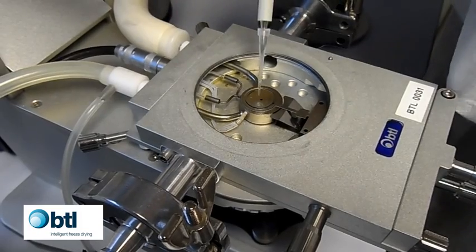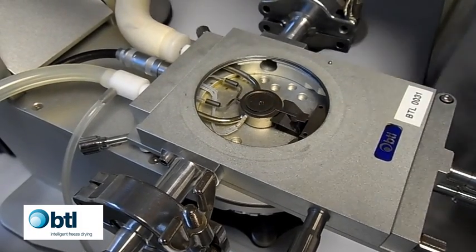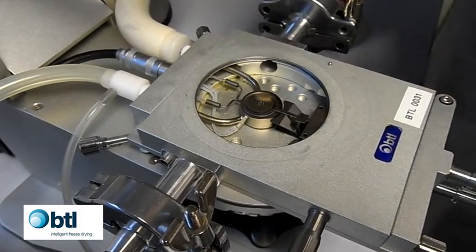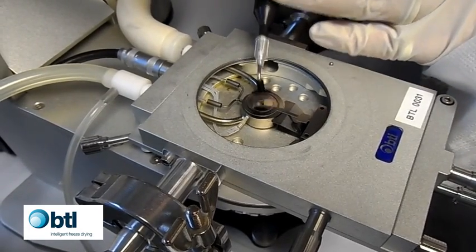Using a pipette, dispense the 2 microliter sample to be tested. Use the vacuum pen to place the glass cover slip onto the spacer over the sample.